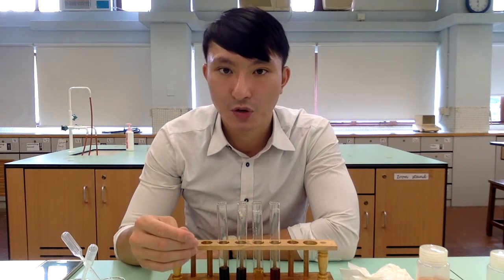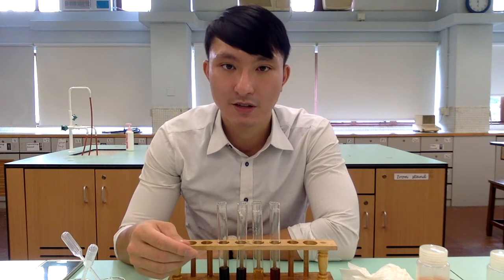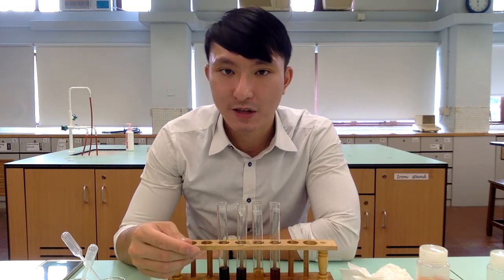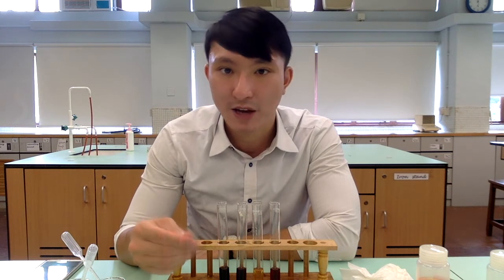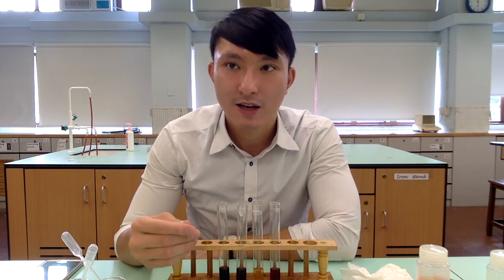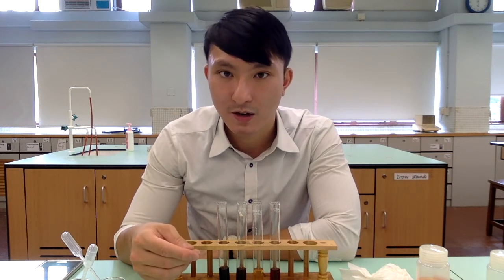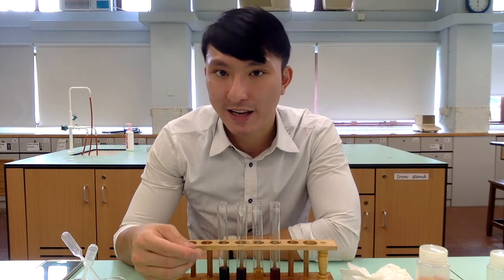Similarly, for test tube two, the addition of additional potassium thiocyanate increases the concentration of thiocyanate ions. Again, the system wants to counteract the increase in thiocyanate ion concentration. Therefore, it will shift the equilibrium to the right-hand side. Doing this, it not only consumes more thiocyanate ions but it also produces extra complex ion product, which again makes the reaction mixture more red or deeper in red color.